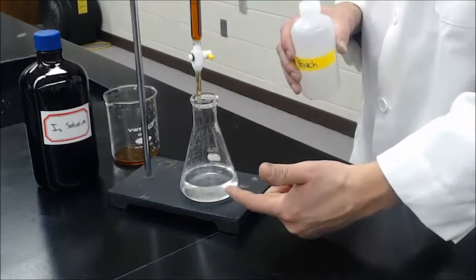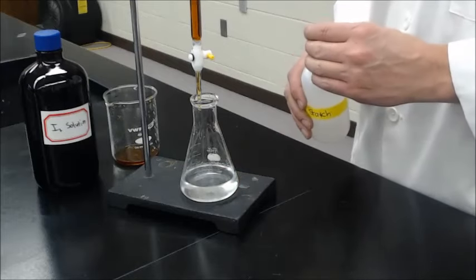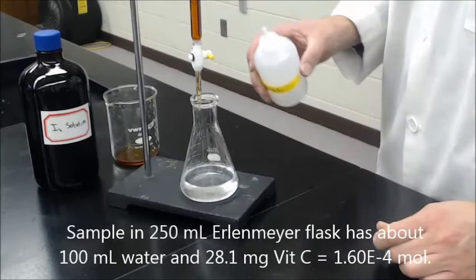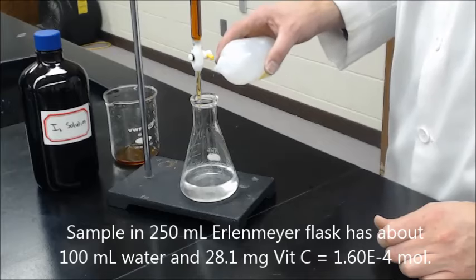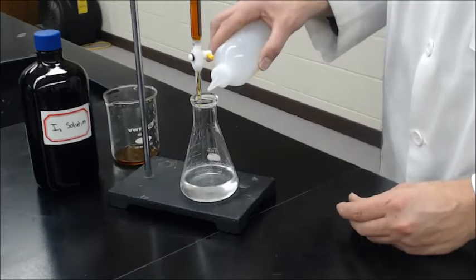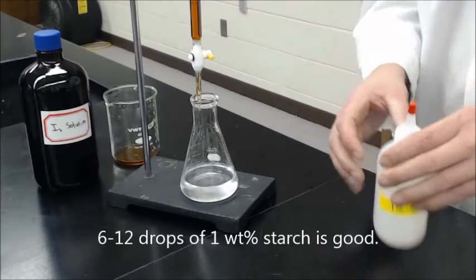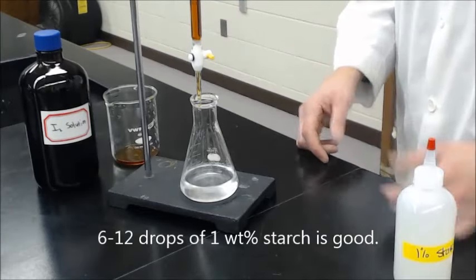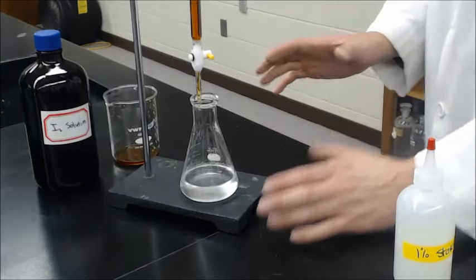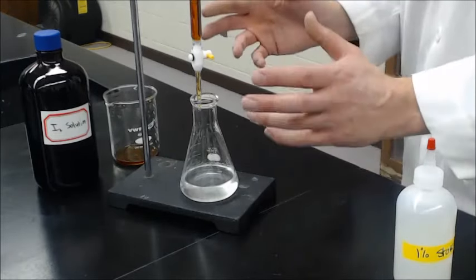That's in the burette. And a known vitamin C solution. I know how many moles I have in here. I weighed out 28.1. Now I'm going to add some 1% starch. That will be used as the indicator. 1, 2, 3, 4, 5, 6, 7, 8, 9, 10, somewhere in there. This is about a milliliter. That's around 10 drops. It's not critical that you get the exact amount. You just need 6 to 10 to 12 drops.